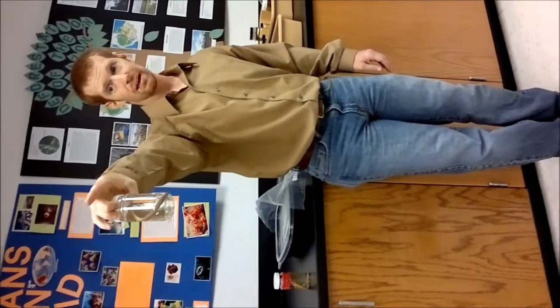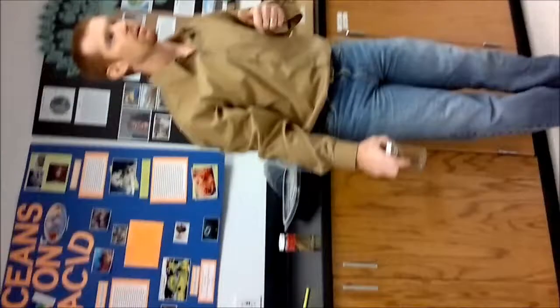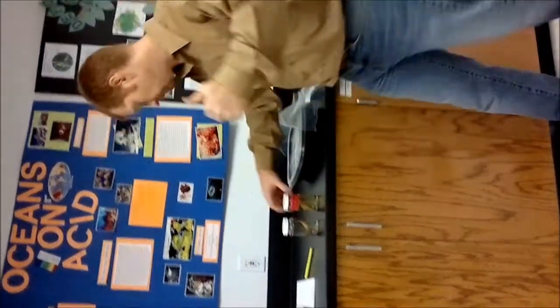But Petromyzontida here is the lamprey. Within the lamprey, again, there's a specimen here. There's also a specimen over there in that box. The lamprey, again, has 4 parts you need to identify. It's the same 4 parts that we just got through discussing with the lancelets. Again, muscular postanal tail, pharyngeal slits, the notochord, and the dorsal hollow nerve cord. Simple enough? We got it? All right, keep moving. Here we go.